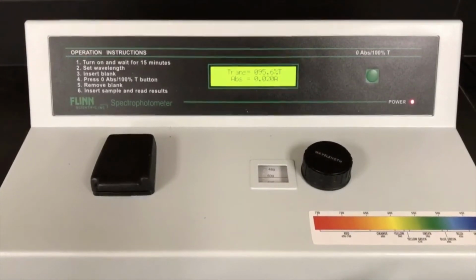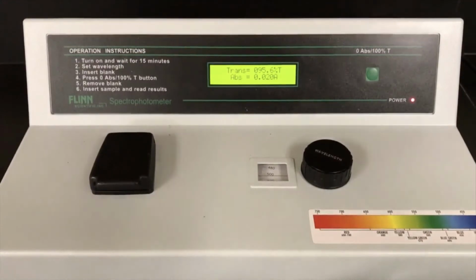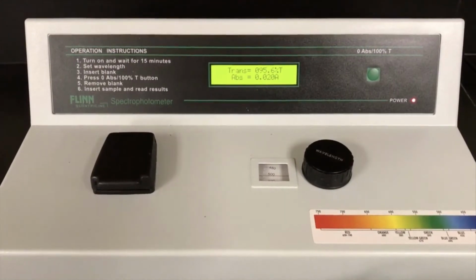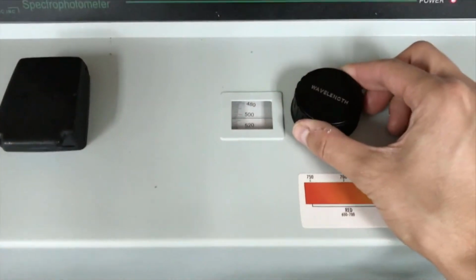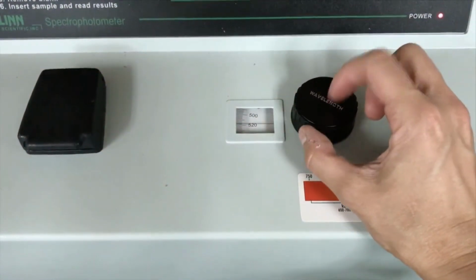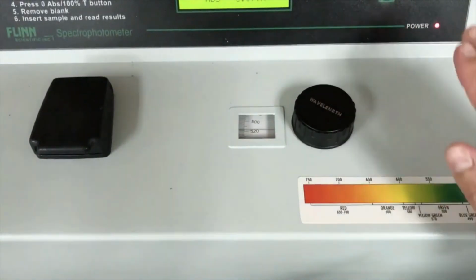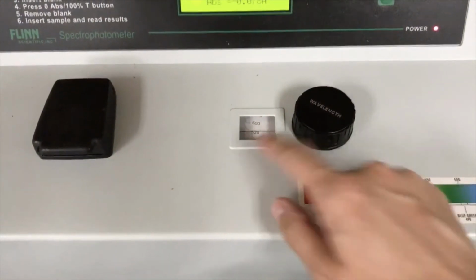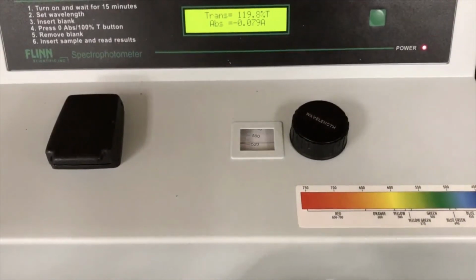Now, one thing that I didn't mention, before you use your spectrophotometer at all, one of the instructions in your pre-lab was to determine the proper wavelength. So if you notice right here, this says wavelength, you can adjust to the correct wavelength, whatever you decide. Once you adjust it at the very beginning, before I did anything, any of what I just did, you need to have that set and then you're going to leave it alone. You're not going to use that anymore, all right?